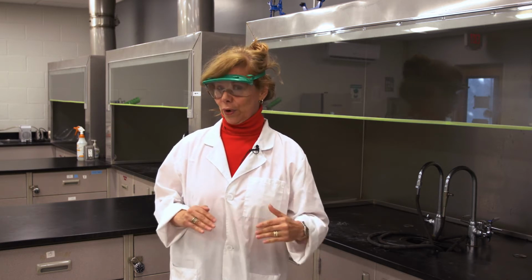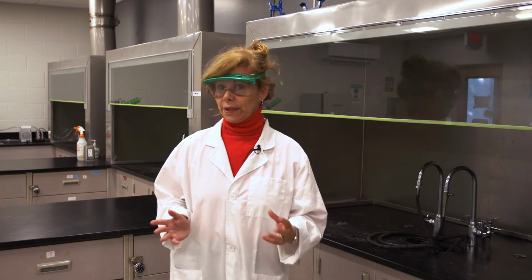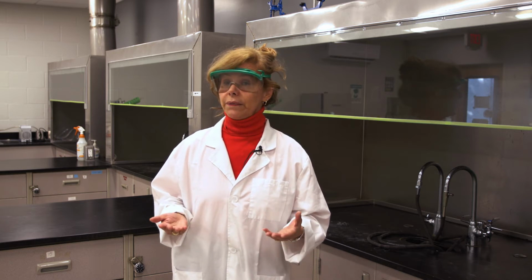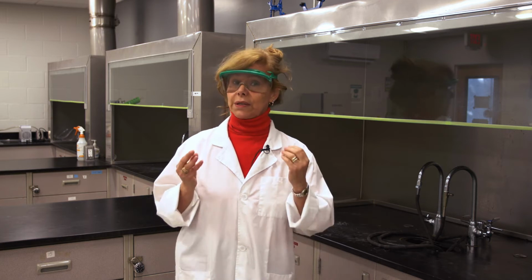So here we're going to talk about special things that we work with at the Organic Chemistry Lab. First, in this lab, we're going to learn about techniques that we're going to be using to do organic chemistry synthesis. And in these techniques and in the procedures in general, we have a number of substances, particularly solvents, that may be flammable, volatile, and even toxic. You cannot inhale those, and they may even be toxic if they get in contact with your skin. Because of that, we need to be extra careful when we're working at the lab.